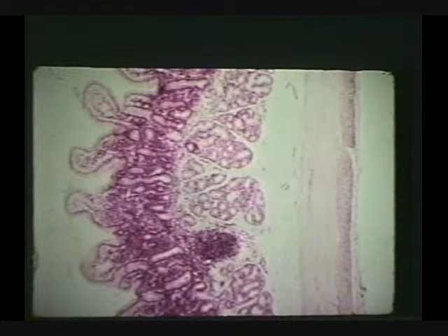Definitely, right? Structure, villus. Membrane, mucus membrane. Structure, crypt of Lieberkühn, an intestinal gland. Structures, Brunner's glands. Tunic, submucosa. Tunic, mucosa. Structure, lymphoid nodule. Tunic, muscularis. Membrane, as specifically as you can identify it.